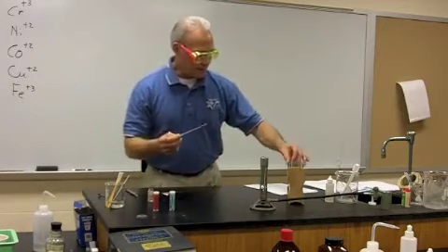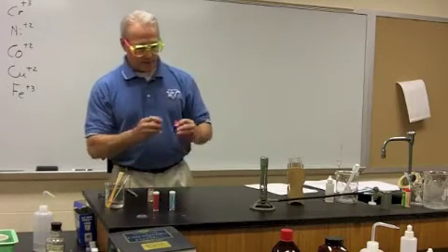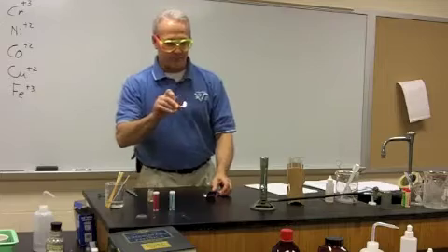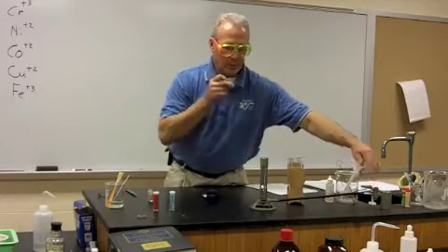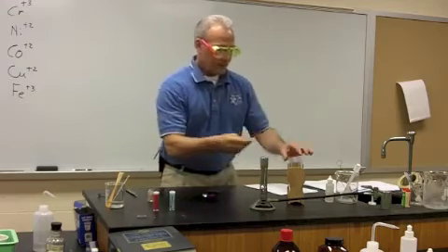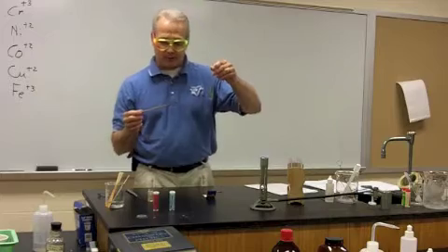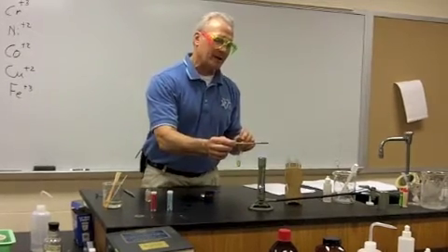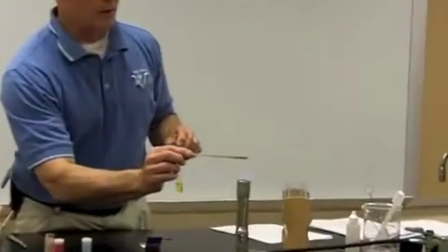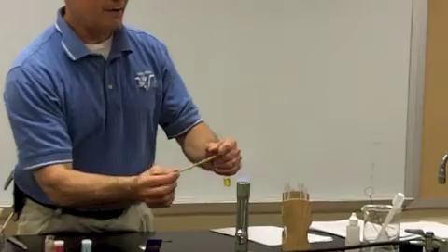So before we get this going, we want to get the Bunsen burner going. In lighting that, make sure you light the match first, then turn the gas on. Okay, we have our stick that's been inserted in the solution of the unknown and our dry unknown, and we'll put it in the flame. What we're looking for is a color other than pale yellow. You can see there's a pale yellow there, not much happening.